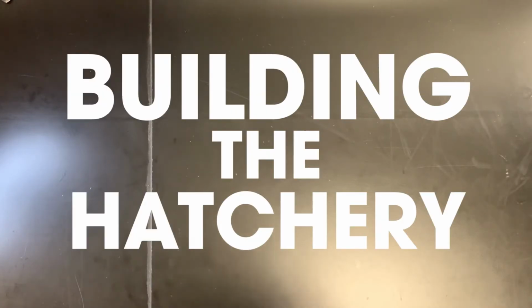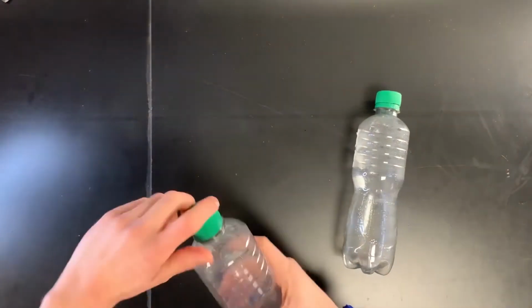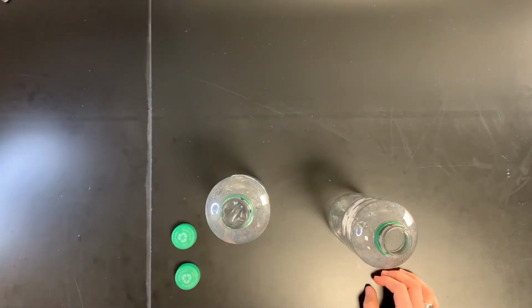The first step in building a setup is to build a hatchery. And to do that, we're going to take 2 plastic bottles. The first thing we're going to do is we're going to take the lids off the plastic bottles and set them to the side. We're not going to throw them away because we're going to need these lids later.